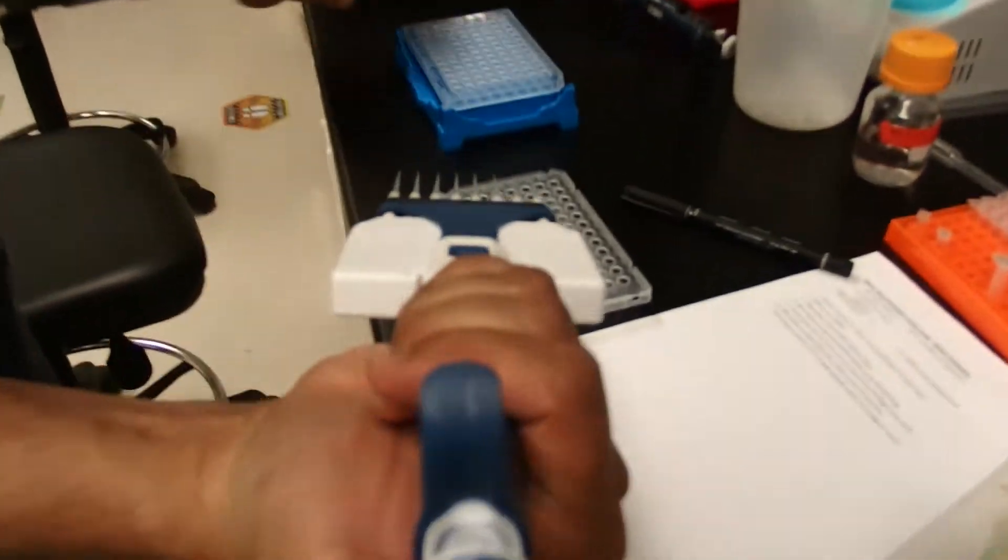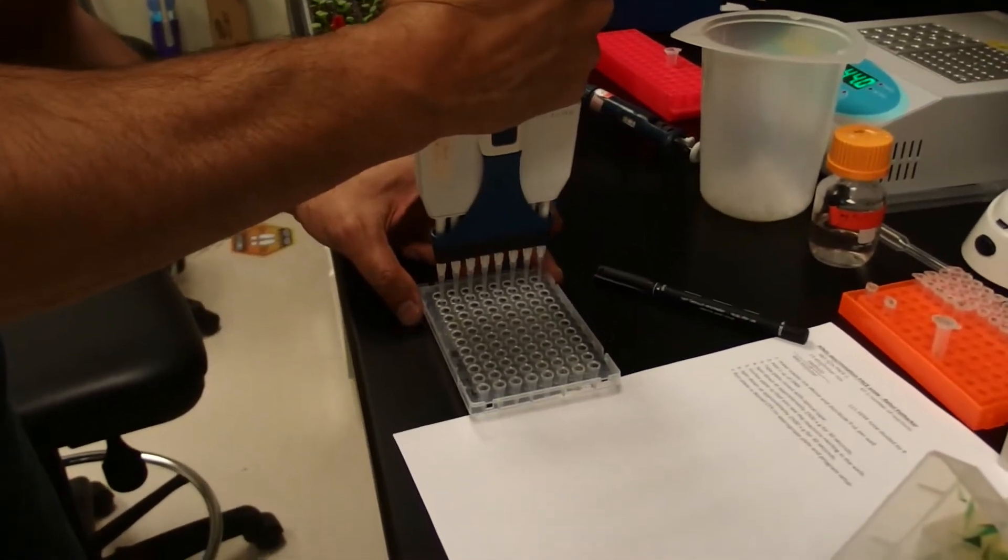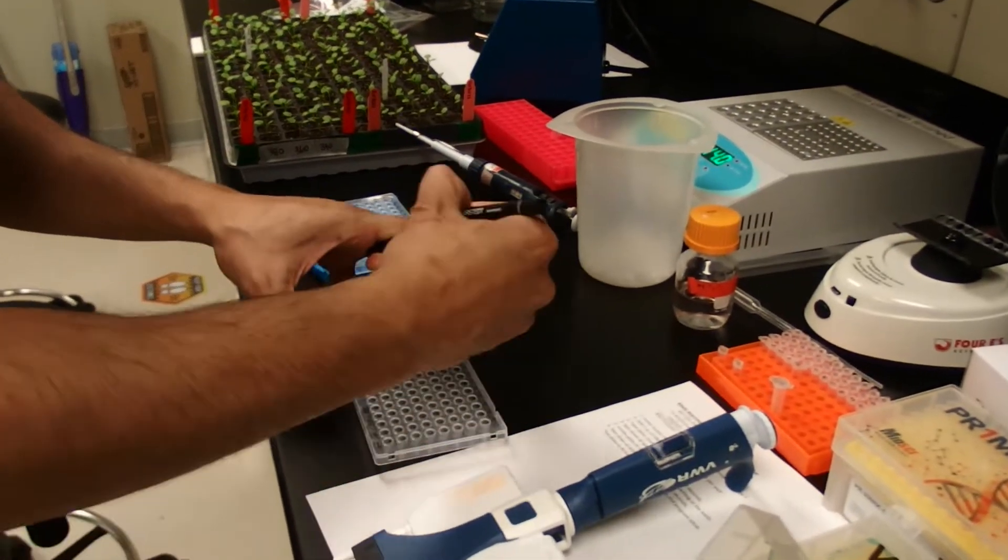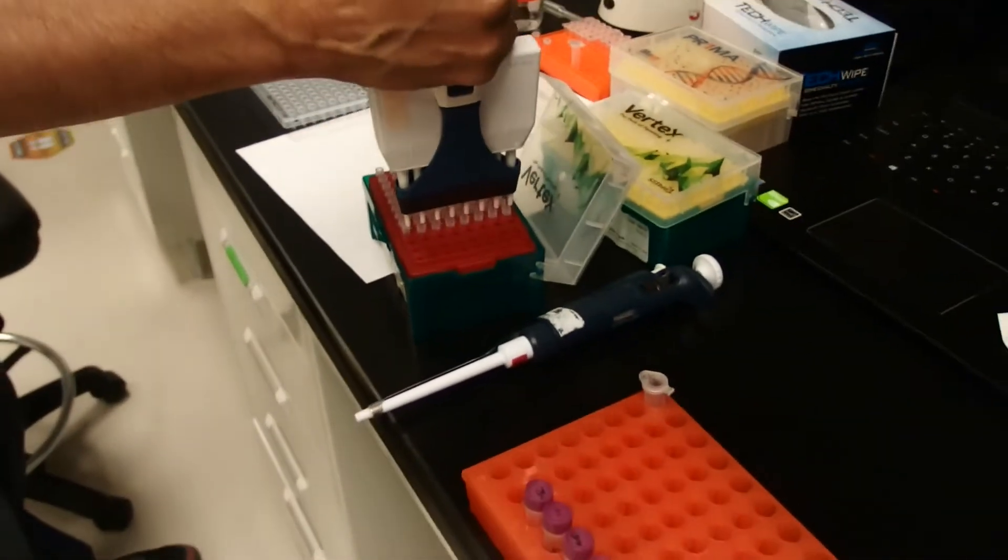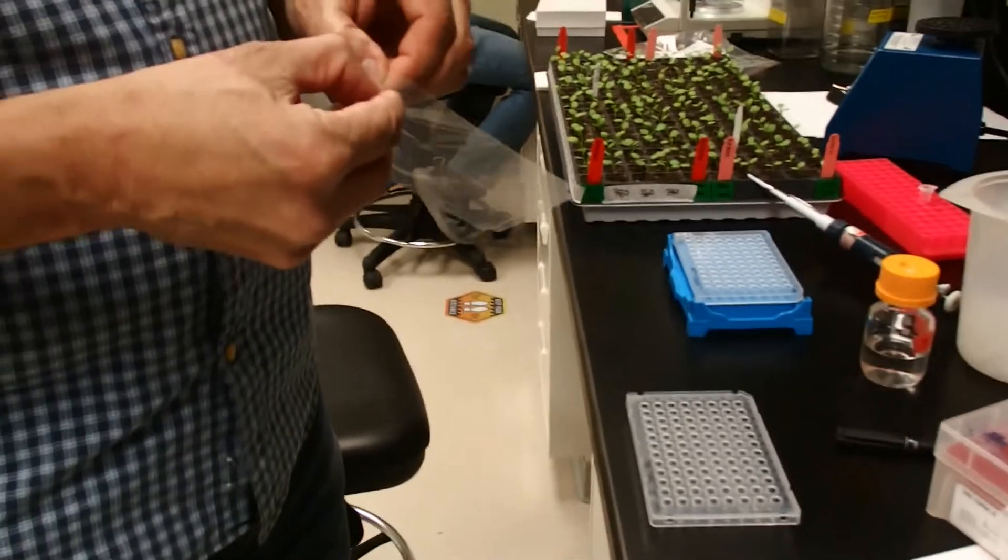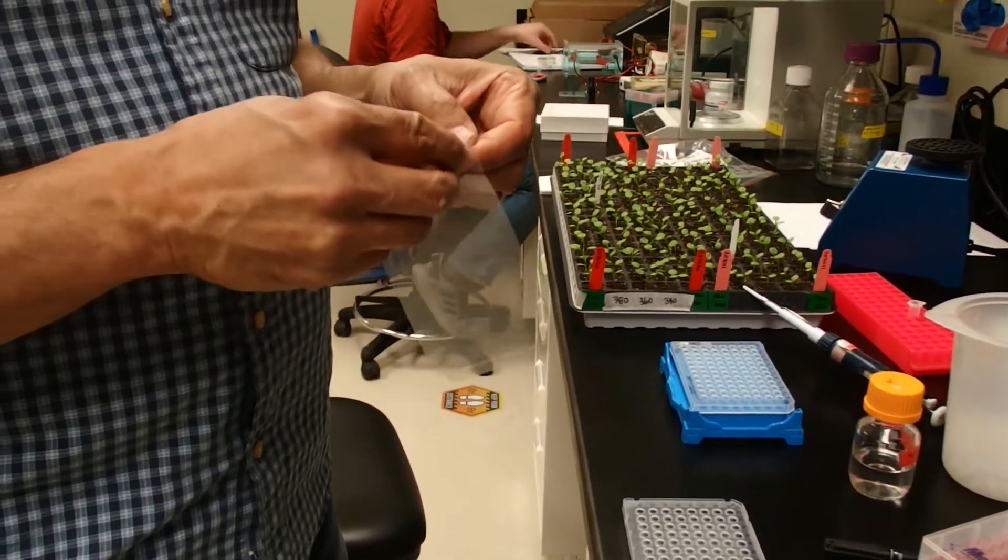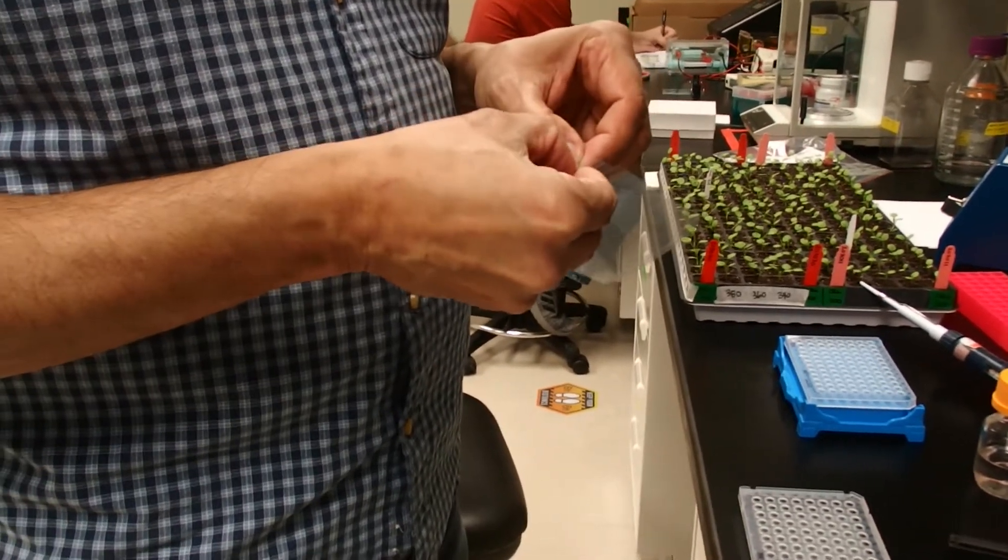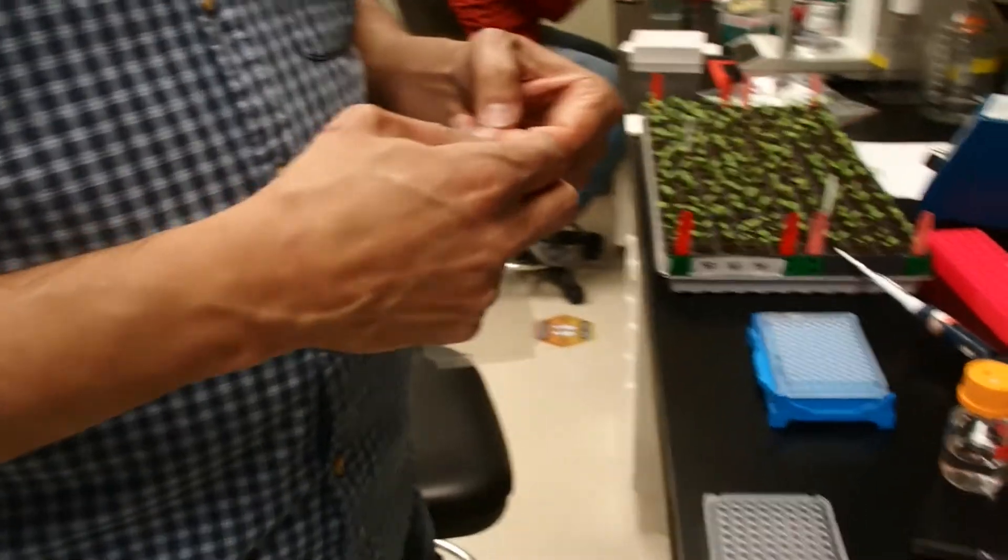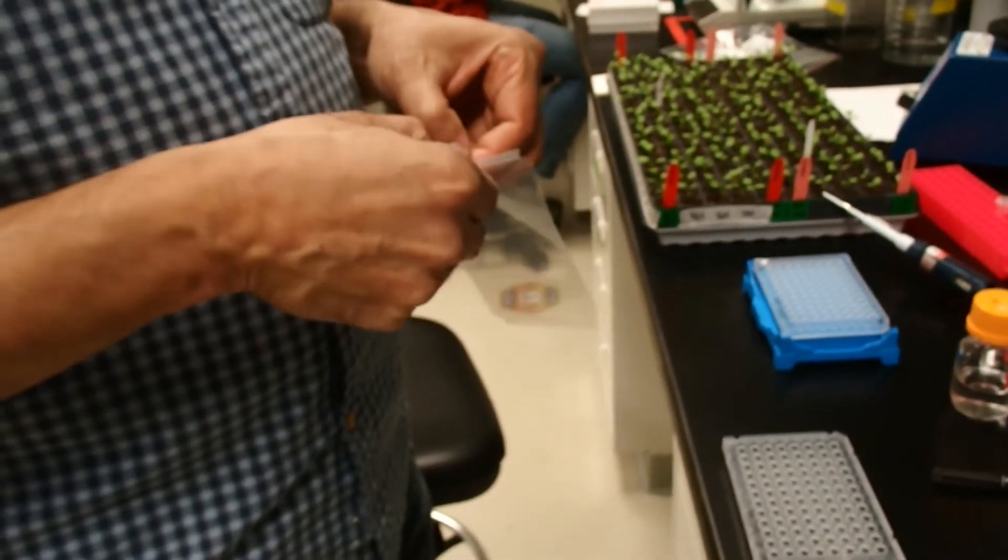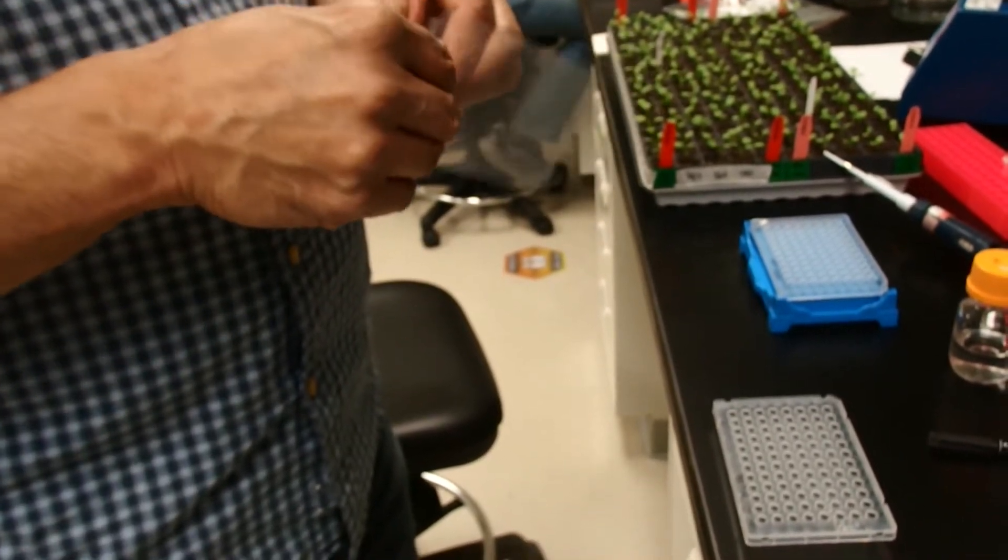I don't think you have to record the whole thing. Now that the plate has been assembled you need to put the optical tape on it. It may be sometimes a little hard with this particular brand to peel it apart, but we want to save the piece that is not sticky.